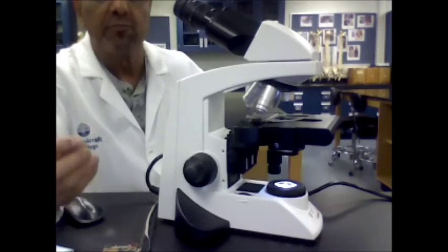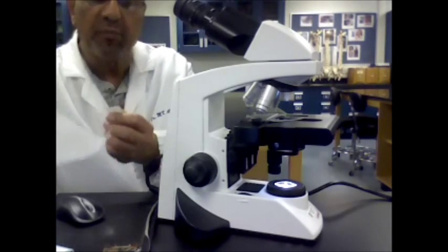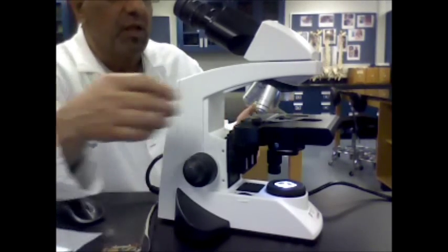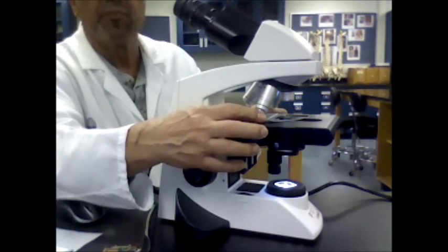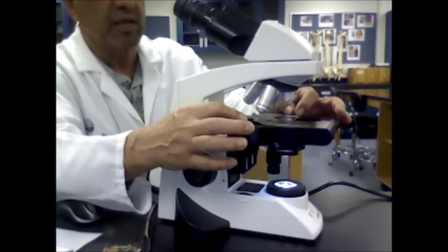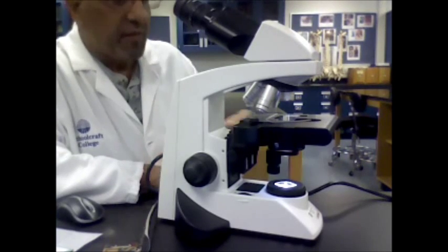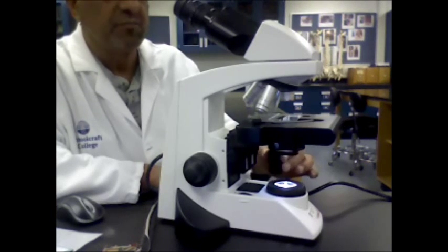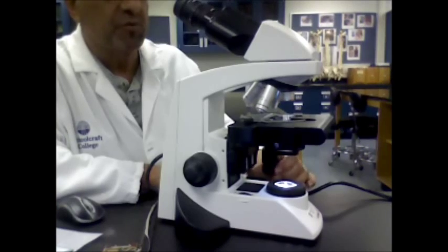Then you're going to get your slide. If it is a prepared slide, be sure the slide is clean — you can use a Kim Wipe to wipe off the side of the slide. The microscope is equipped with a mechanical stage. Open the clip, slide the slide onto the stage, and release the clip to hold the slide. There are two knobs on the side: one moves the slide forward and backward, and the other moves it side to side.